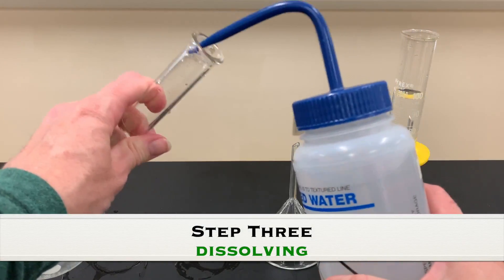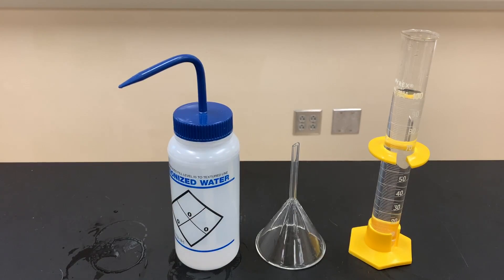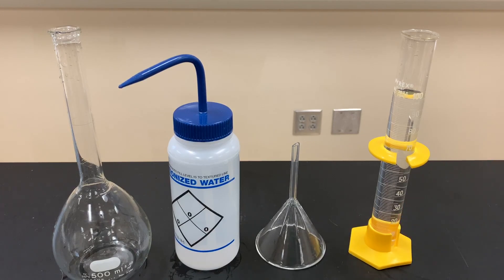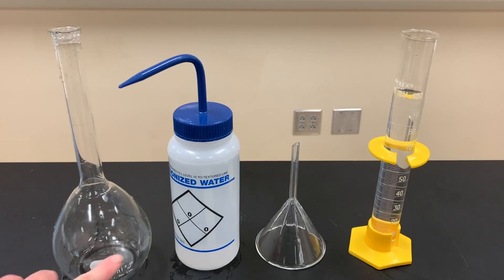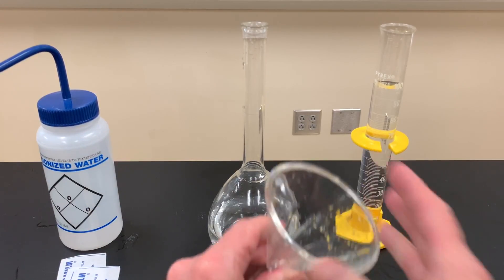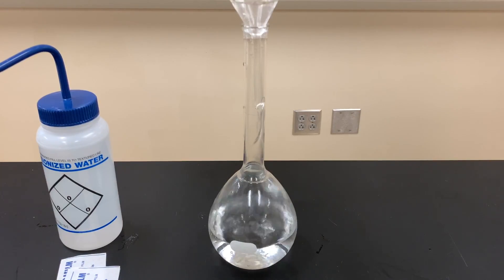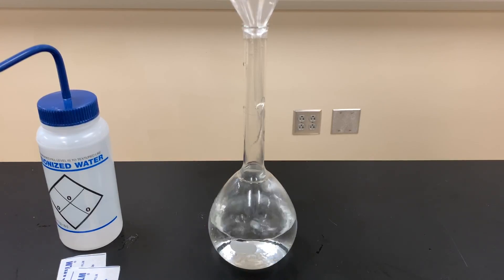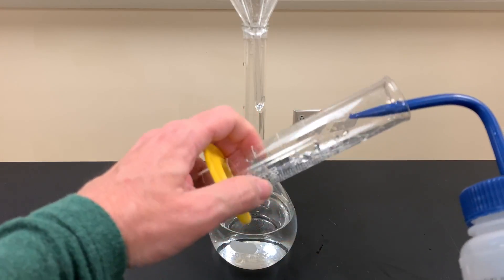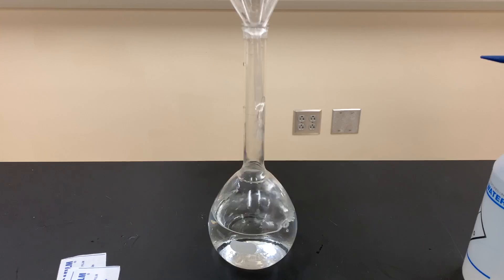Rinse your volumetric flask with distilled water and discard it to remove any contaminants. Add distilled water to fill the flask about halfway before adding your stock solution. If using a funnel, rinse it with distilled water first. Then slowly pour your measured stock solution from the graduated cylinder into the volumetric flask through the funnel, being careful not to overfill it.